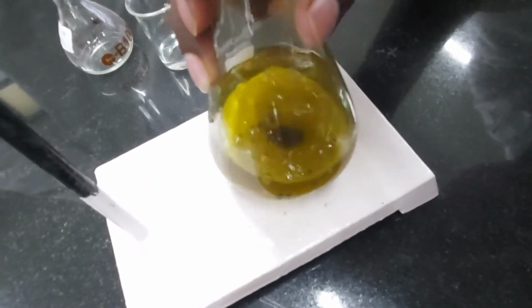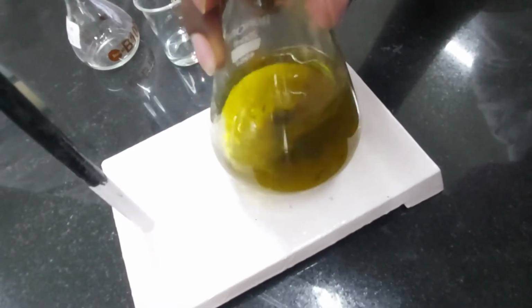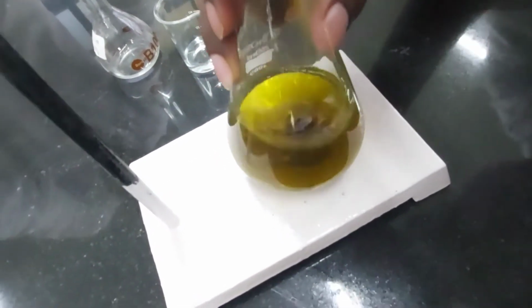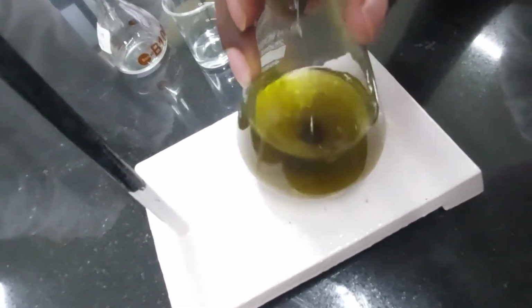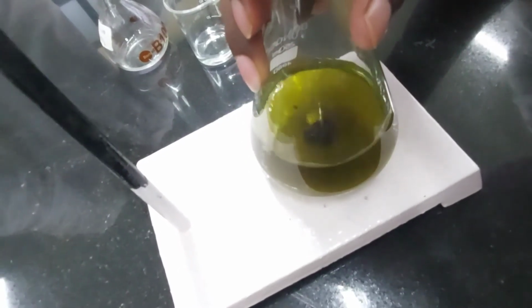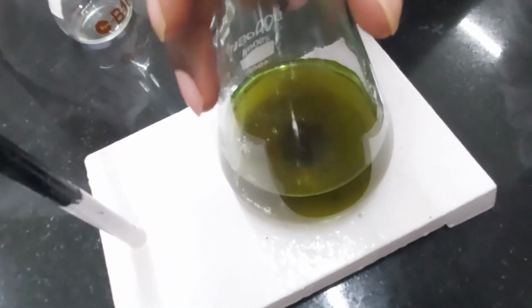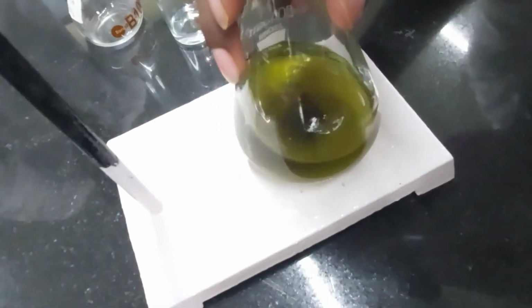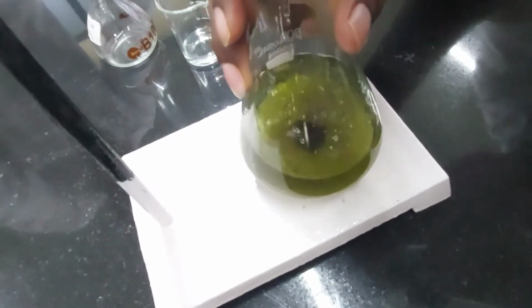Still a bit yellow. Okay, okay. Okay, that is almost gone. Almost gone. Can you stop for a while, Mayuresh, to show them that the yellow color is almost done. We are done with all the yellow color. It's quite green. Now we can continue further. Right. Going on again.